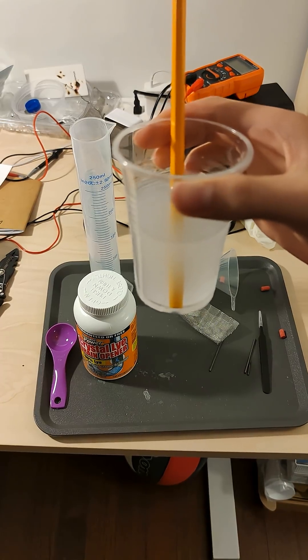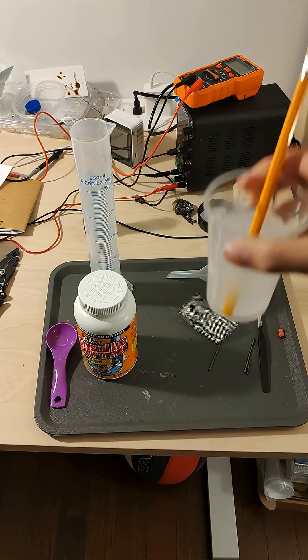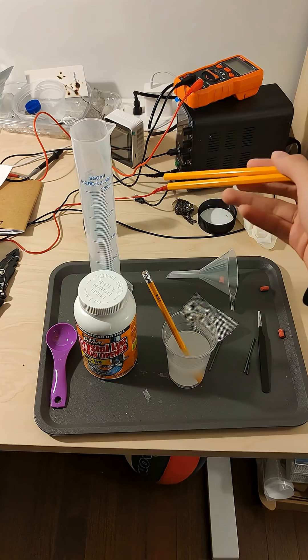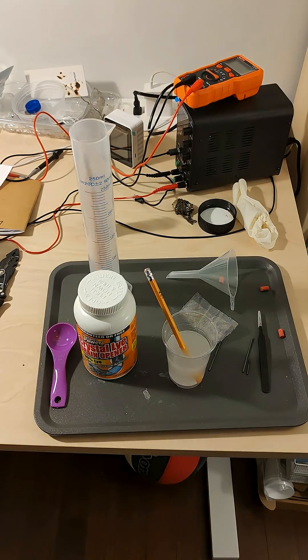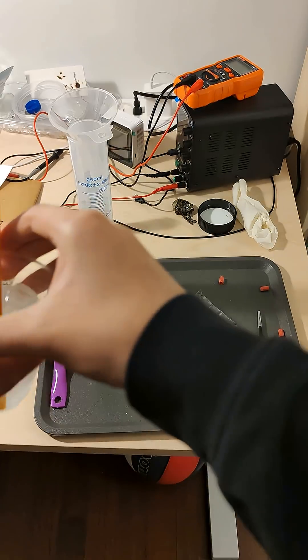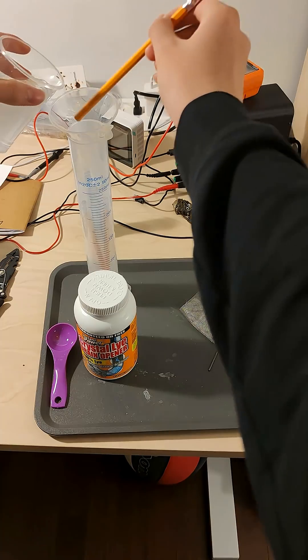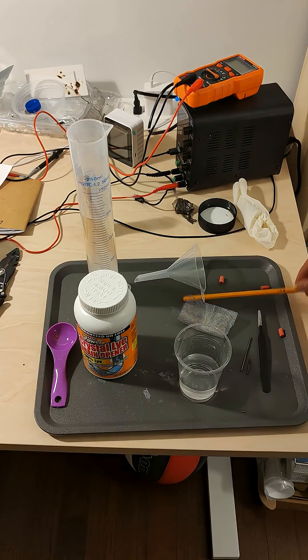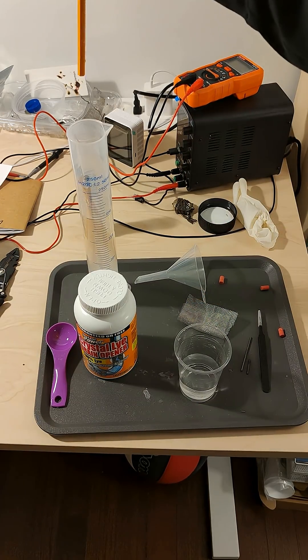At this point it is considered done, and we can take a look at our reaction vessel, which will be this grad cylinder — or we can use anything that's thin and long. So we're going to pour these inside, and then this pencil can go in.